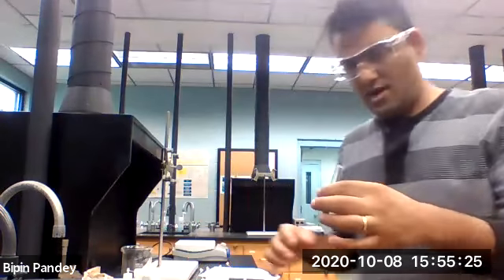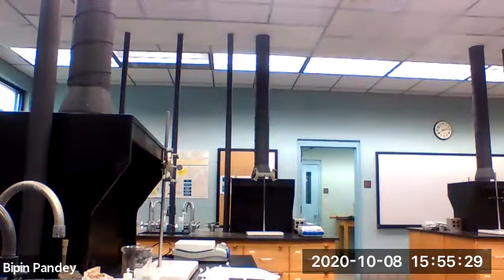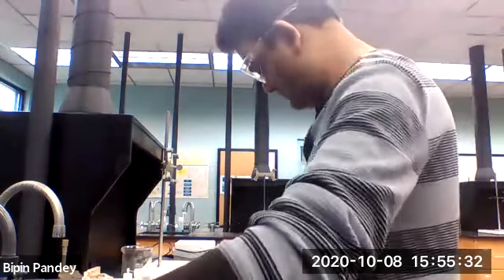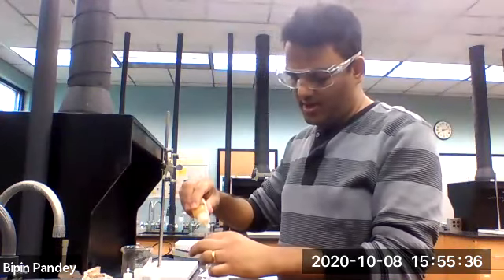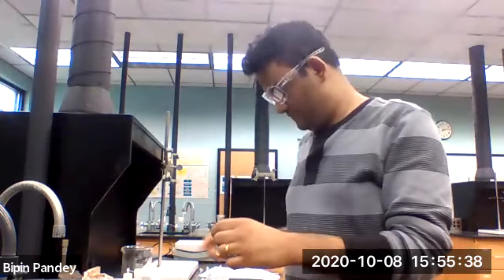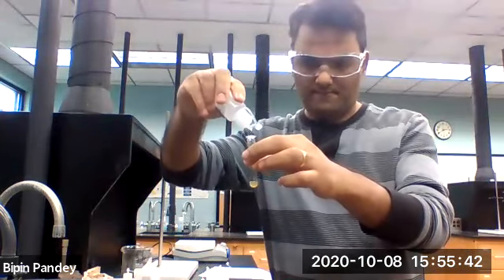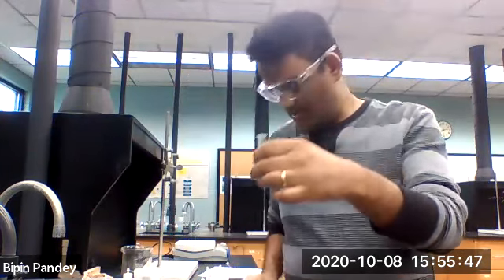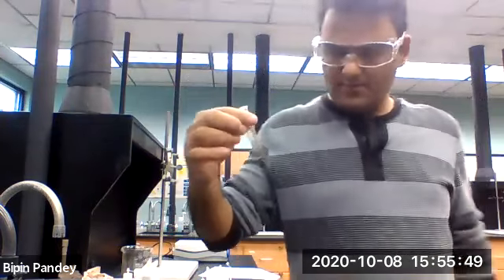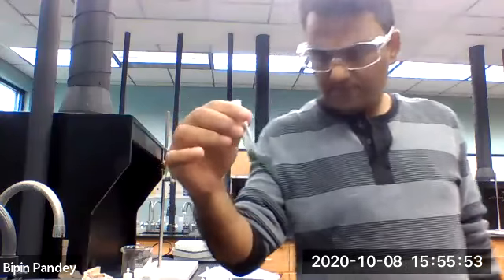So iron with carbonate is a precipitate. Let's react the iron with hydroxide. Okay, so I'm making the same kind of precipitate, greenish precipitate. So it reacted with hydroxide also.